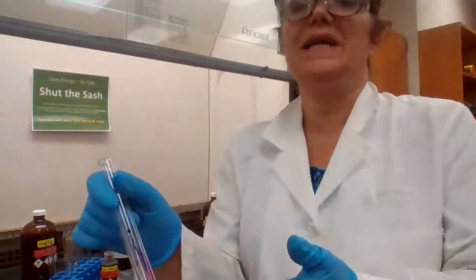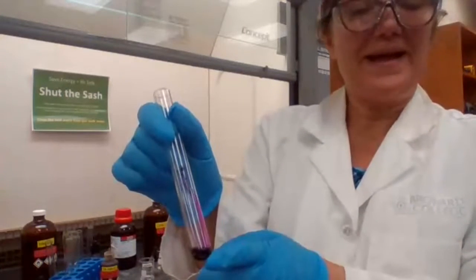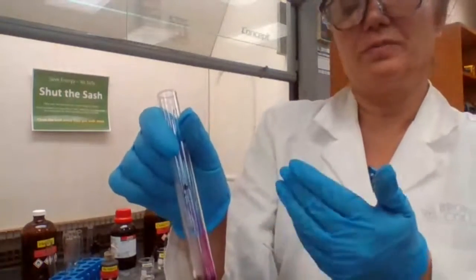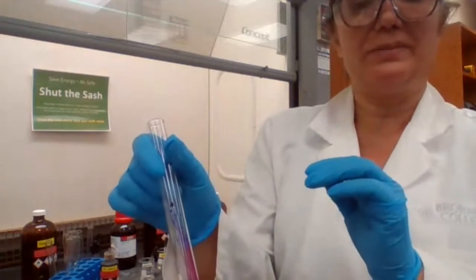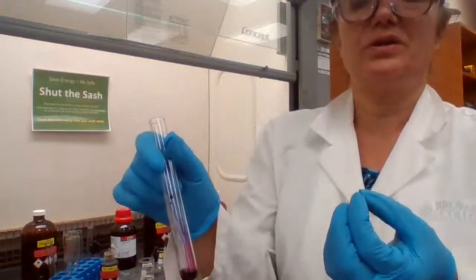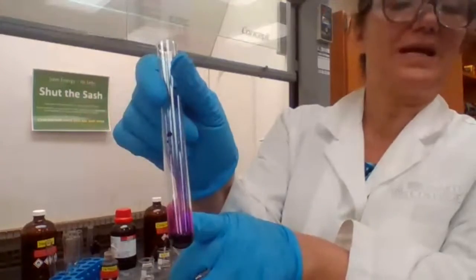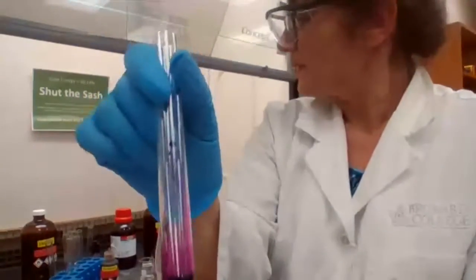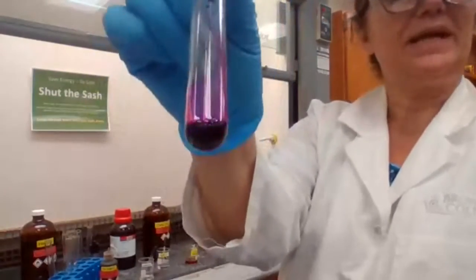Permanganate is an oxidizing agent. The oxidizing agent is going to be reduced itself. So permanganate would change to manganese dioxide, MnO2, same product you had for experiment 12, the brown precipitate. But if there is no reaction, the purple color would stay. So this is the first reaction, and that is the reaction of hexane with permanganate. Okay, hexane with permanganate.